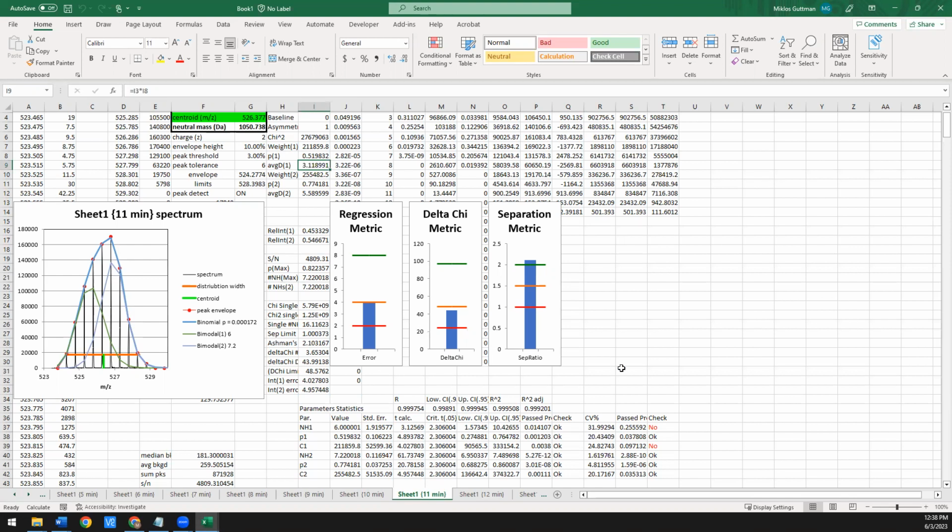The closer they are, the lower this bar will be. And in theory, if they're really close or on top of each other, you shouldn't really be able to get any kind of information out of it just because they're not well resolved. So really, when you're looking at the data and you want to assess, all right, can I actually extract these numbers with any confidence? I would look at this graph first.